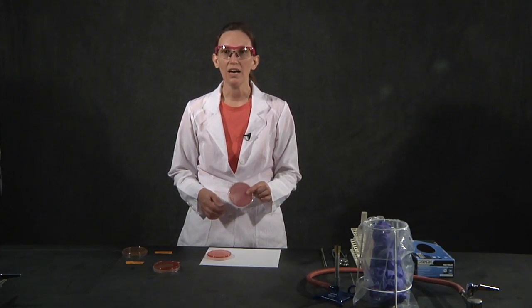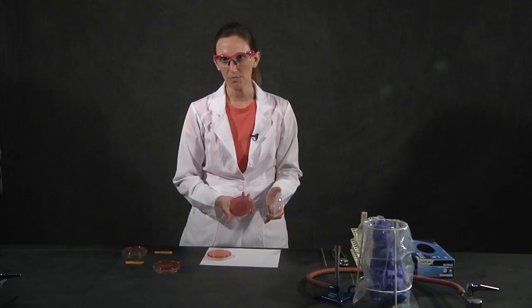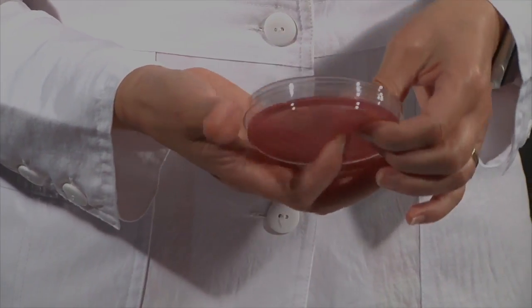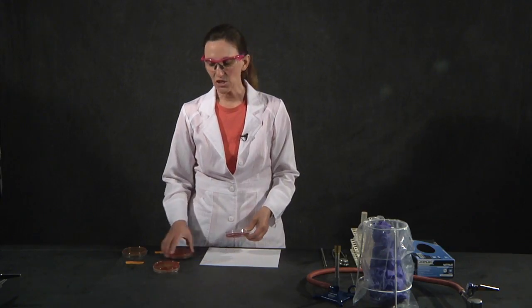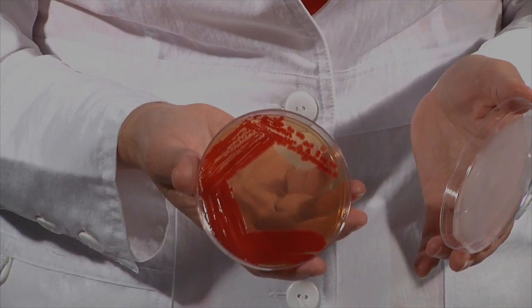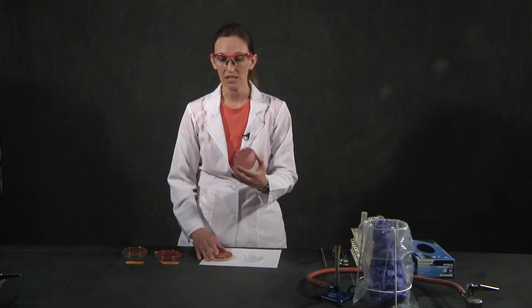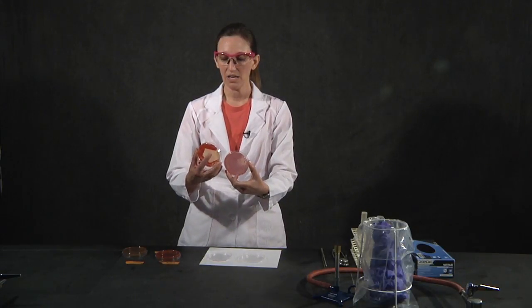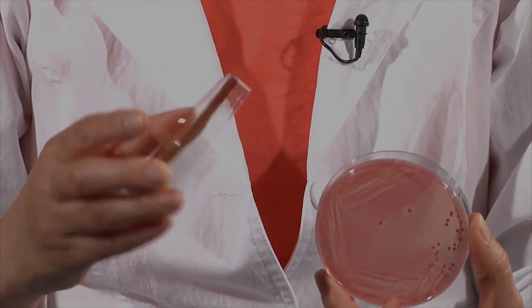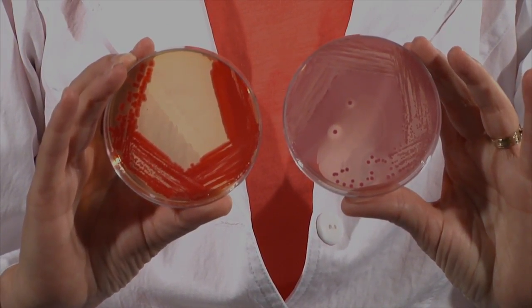This, however, is an example of an enteric that does ferment lactose. We call this a coliform, and the colonies themselves are a dark pink-purple because the neutral red reacting with the acid produced by lactose fermentation has turned that color. The media around them is also pinkish. I want to show you a false result — this is an organism that produces a natural pigment that makes it red when grown at room temperature. It's bile-tolerant, so it grows. But if we compare the color of the media between the lactose fermenter and this non-lactose fermenter, the agar is not pink itself, but the natural pigment in this organism is bright red. So this can be mistaken as a positive. I will always have the example plates in the front for you to look at and compare yours to.